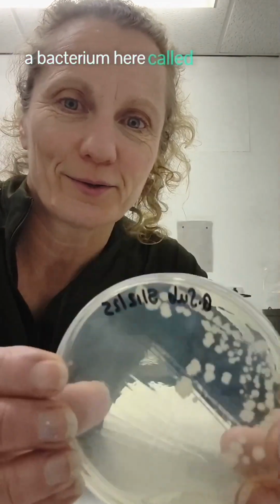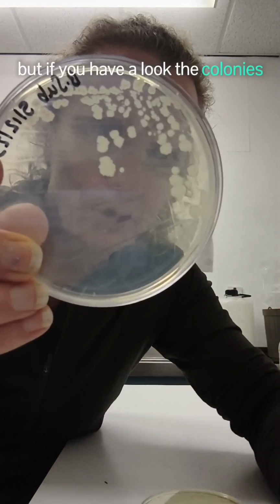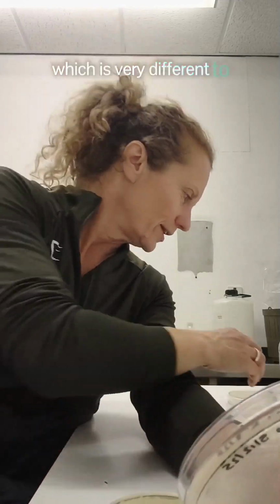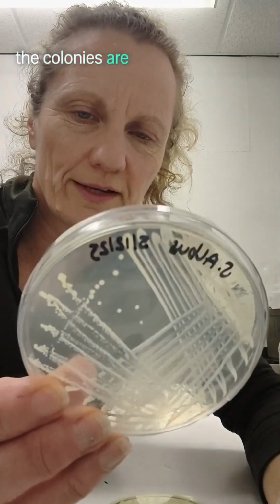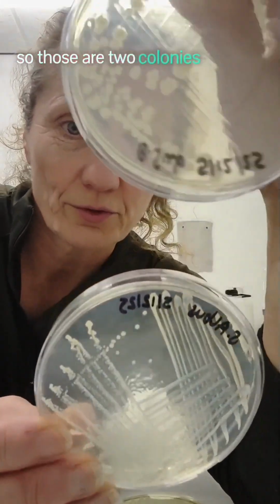A bacterium here called Bacillus subtilis. This is a soil bacterium, very common, but if you have a look, the colonies, they're very flat and dry, and can you see they're quite irregular? They're also quite large, which is very different to Staphylococcus. This is a well-known skin flora. The colonies are white and dry, and they're sort of smallish, and they're nice and circular. So those are 2 colonies that are very different.